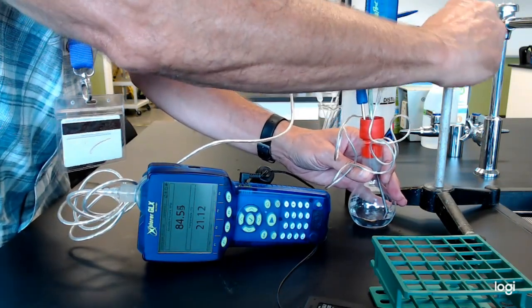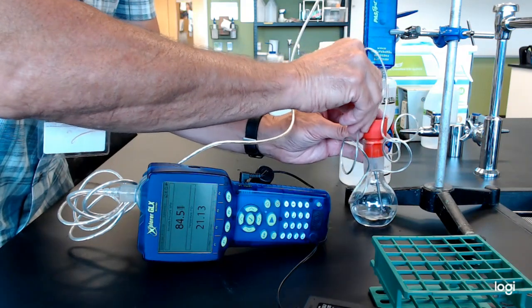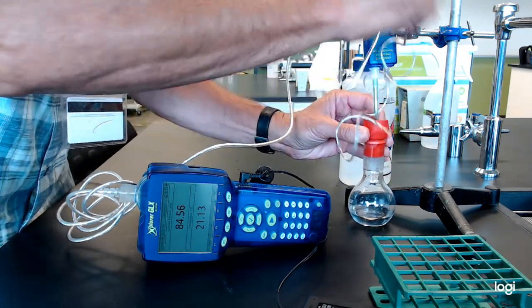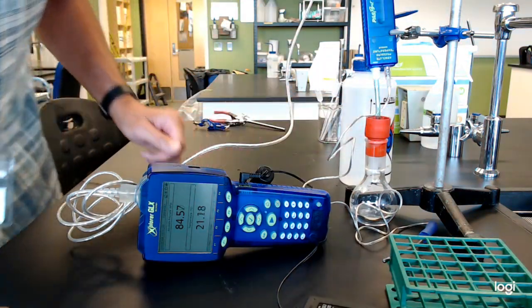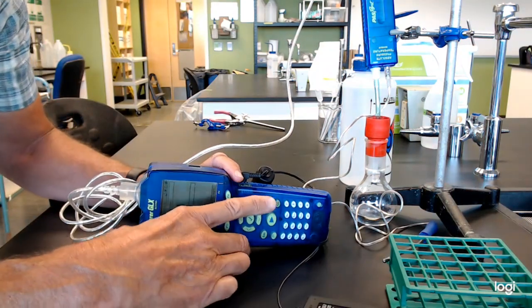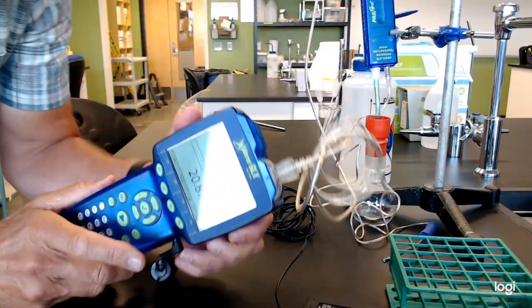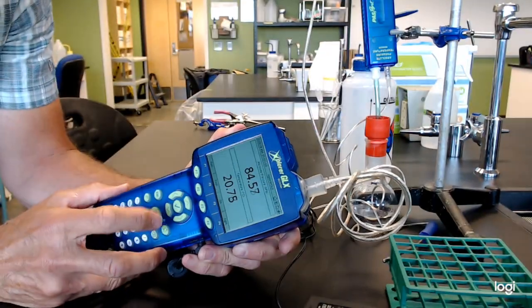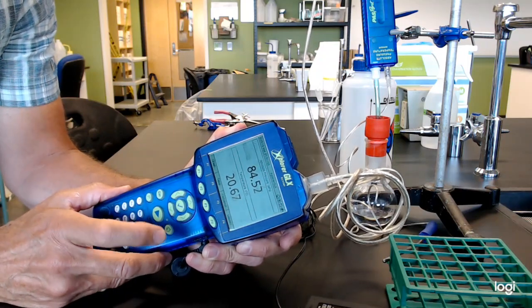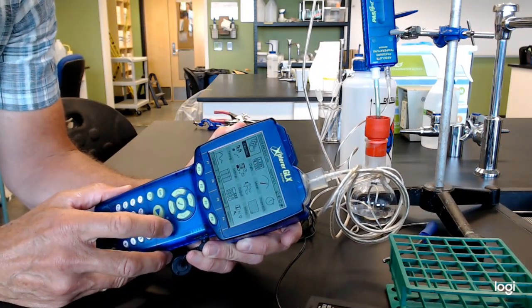That's a side note, because I really want to focus on getting data on this thing. So here's what we're going to do. I'm going to just get you some data to work with. I'll get the thermocouple probe.